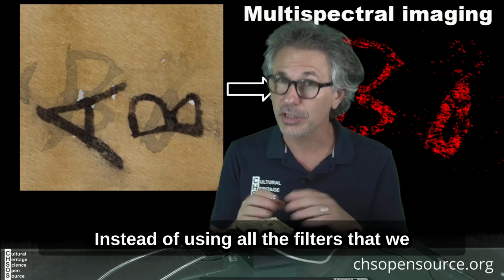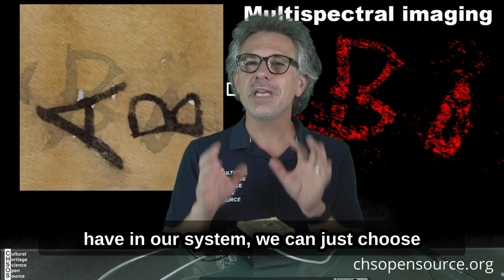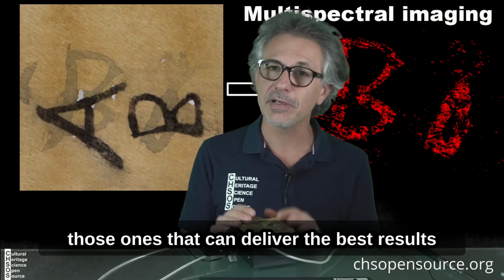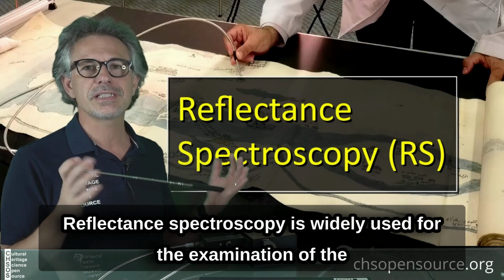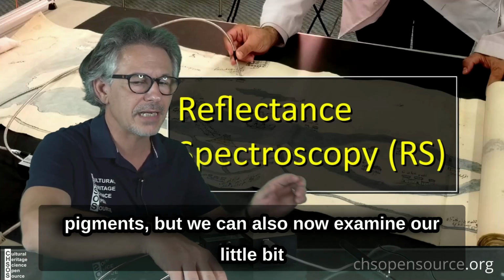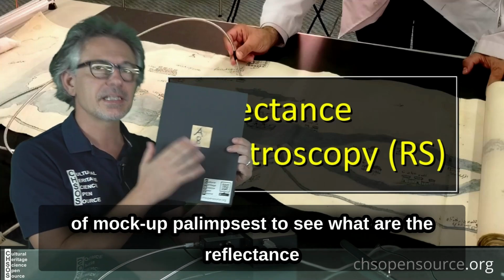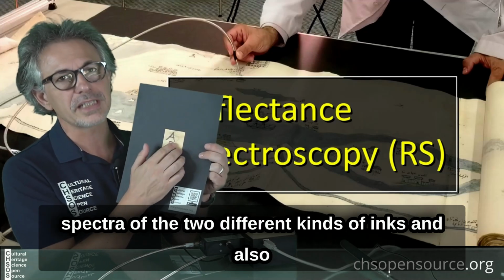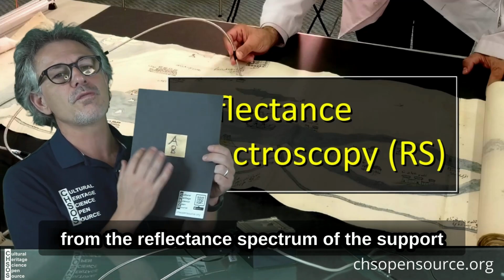Instead of using all the filters that we have in our system, we can just choose those ones that can deliver the best results. Reflectance spectroscopy is widely used for the examination of the pigments, but we can also now examine our little bit of mock-up palimpsest to see what is the reflectance spectra of the two different kinds of inks, and also from the reflectance spectrum of the support.